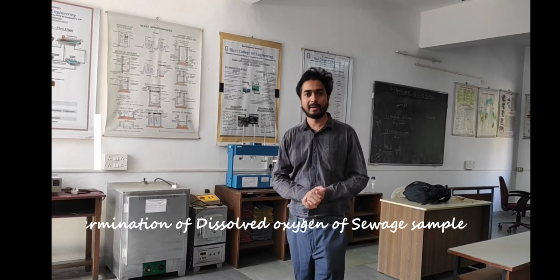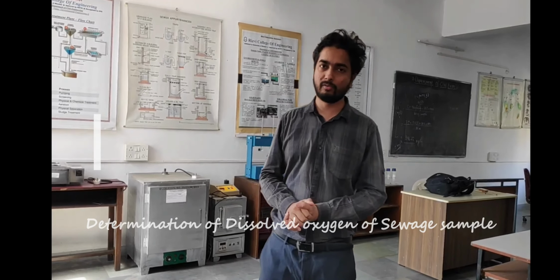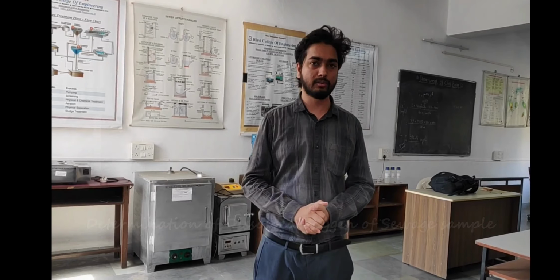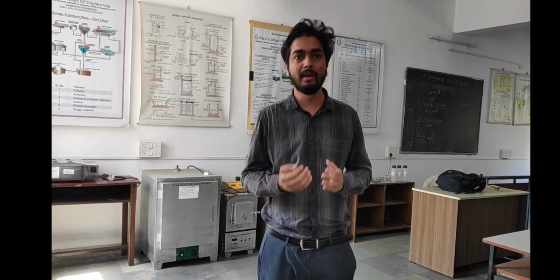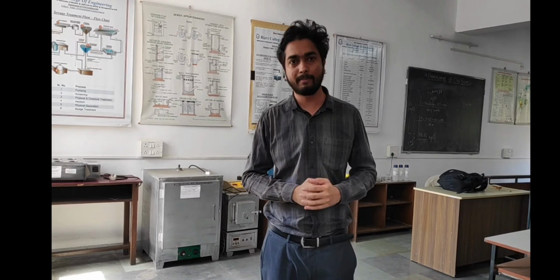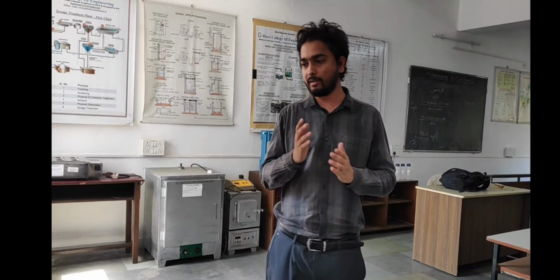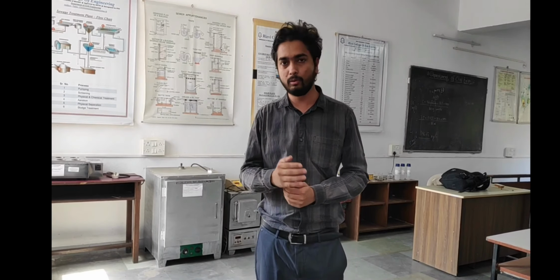Let's start with another practical, which is the determination of dissolved oxygen. Previously we also did the same practical on a water sample. In this dissolved oxygen practical, as the name suggests, we have to determine how much dissolved oxygen is present in the water. For that purpose, I am going to start with the apparatus required, and after that I will tell you the whole procedure.